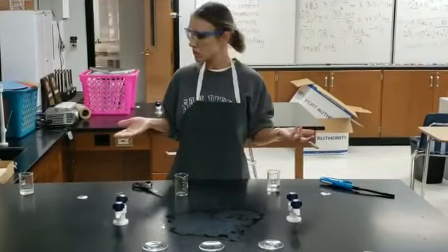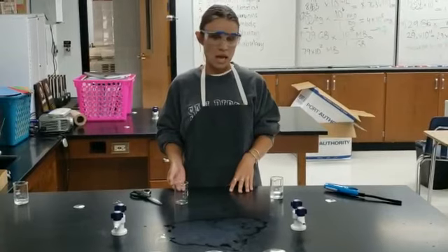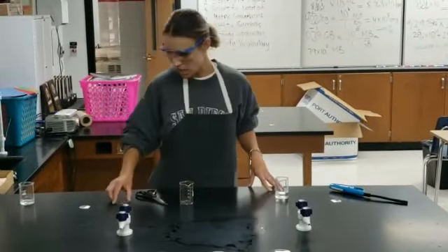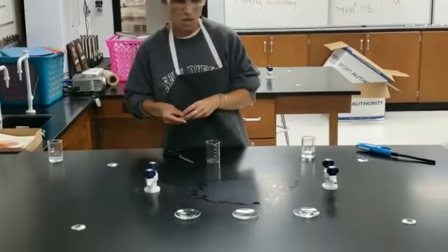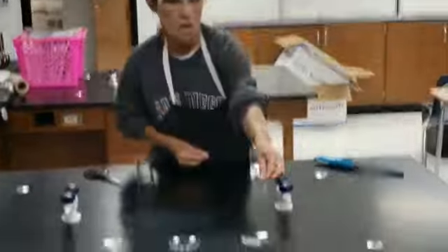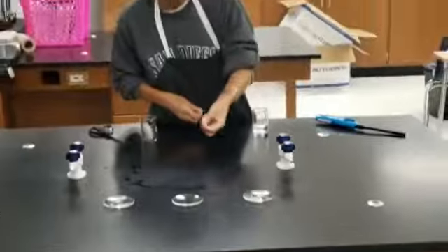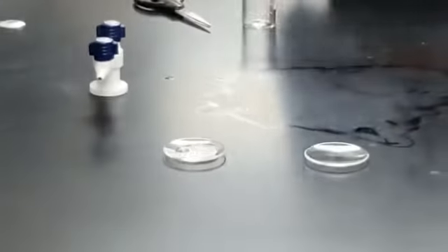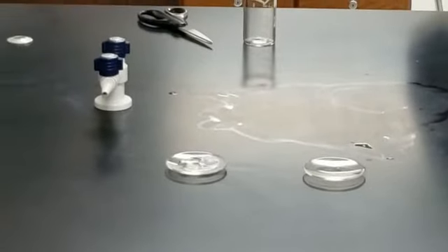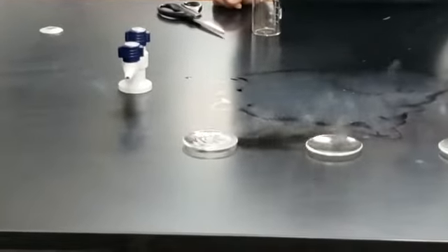Now we're going to continue with our experiment. Obviously one liquid was extremely flammable. Now we're going to do another test. Since we don't know what those two are, I have some metal — my metal is magnesium. I'm going to drop it in. Nothing happened, so that liquid is really harmless. Now let's see what happens here. This liquid is extremely corrosive because it's eaten away the metal.